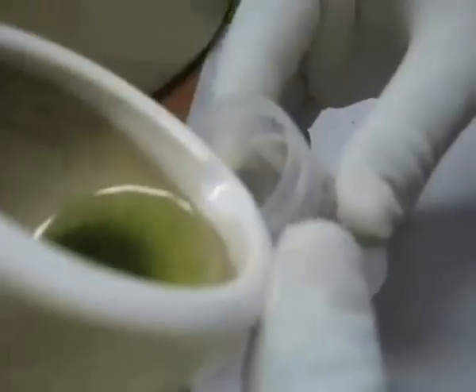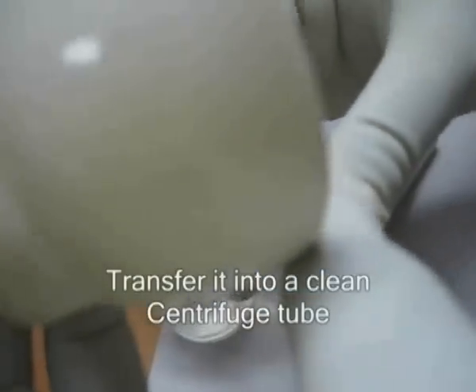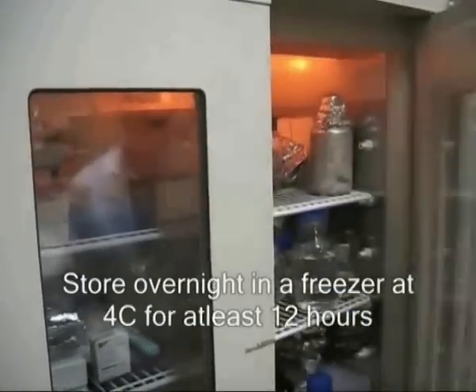This is then transferred into a centrifuge tube. This is then stored in a 4 degree freezer overnight.